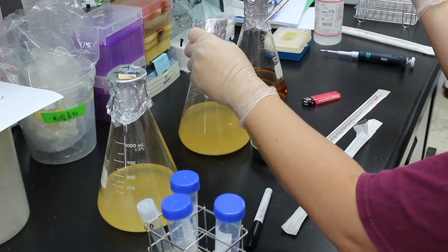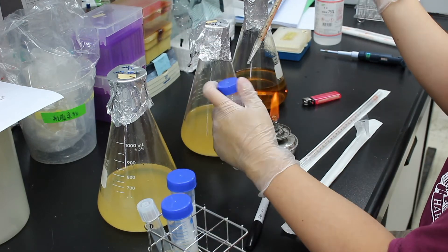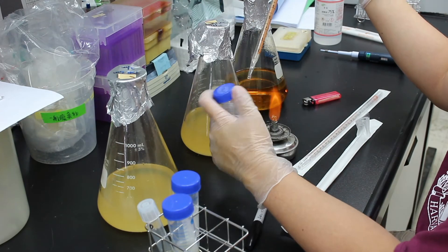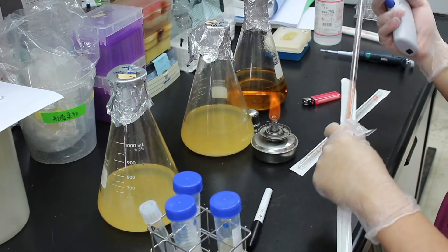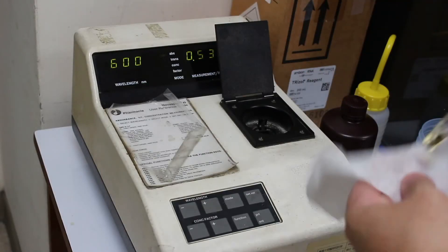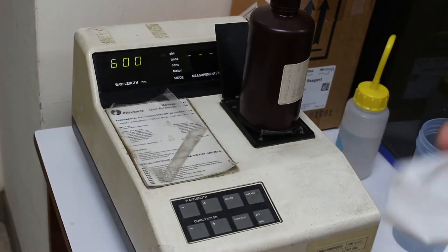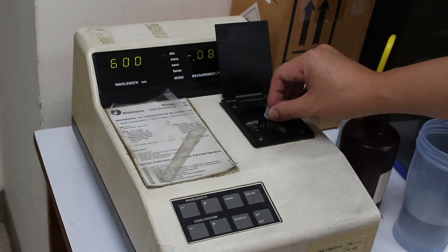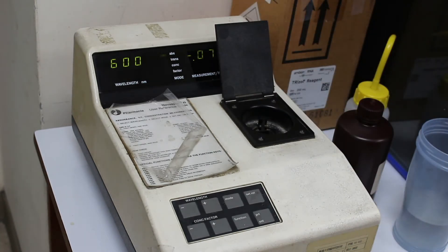By plotting this data with time, I get a growth curve that shows how bacteria grow through time. By comparing growth curves between my homemade medium and the commercial medium, I will know if my medium is good or not.